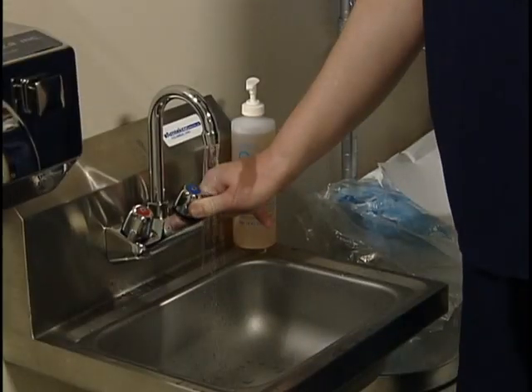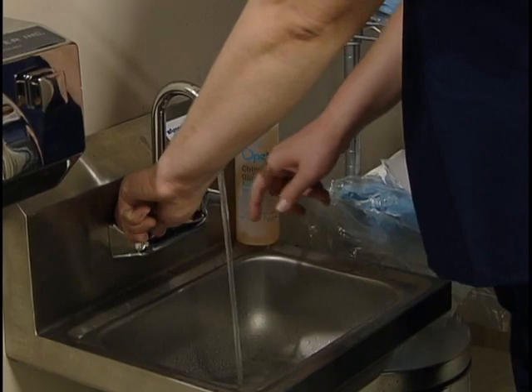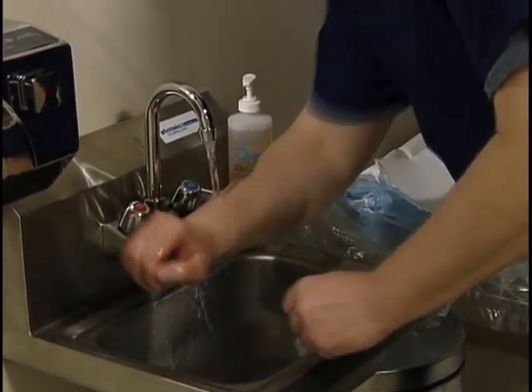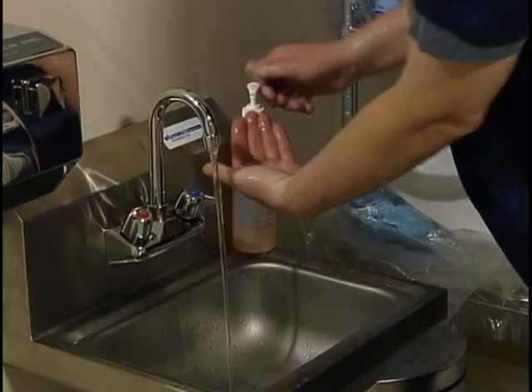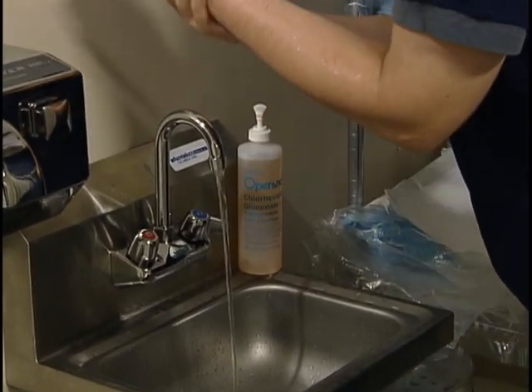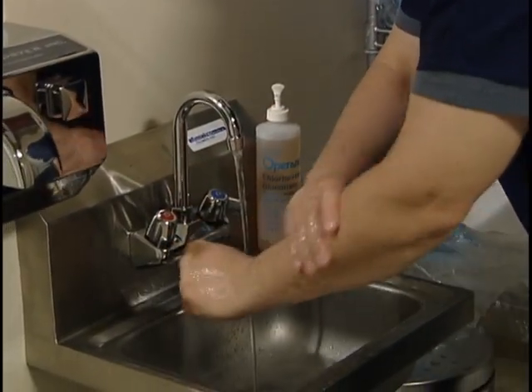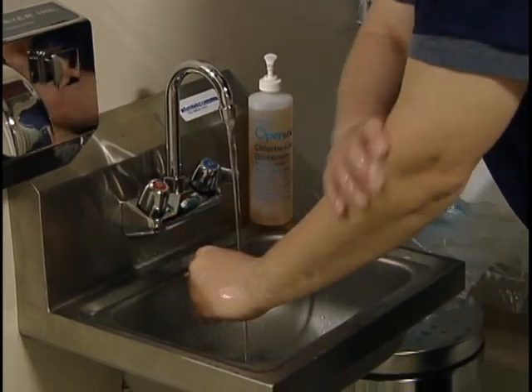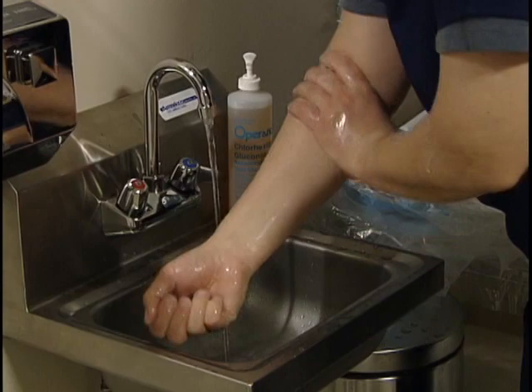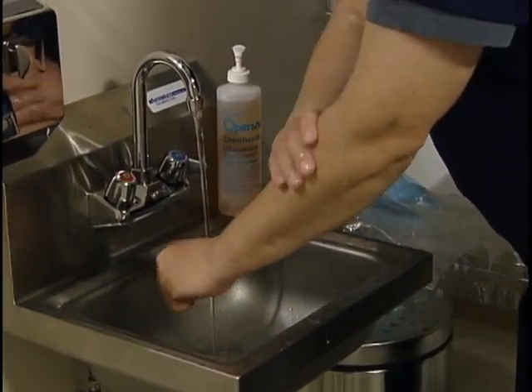Before using any equipment or performing any compounding, you should first remove all jewelry, including rings and watches. Then, using warm water, wet your hands and wrists up to your elbows and let the faucet run the entire time you are washing your hands. Now, thoroughly scrub your hands, nails, wrists, and forearms for at least 30 seconds with a brush, warm water, and appropriate bactericidal soap. Be sure to scrub your palms, the backs of your hands, between each of your fingers, under your nails, and around your cuticles.